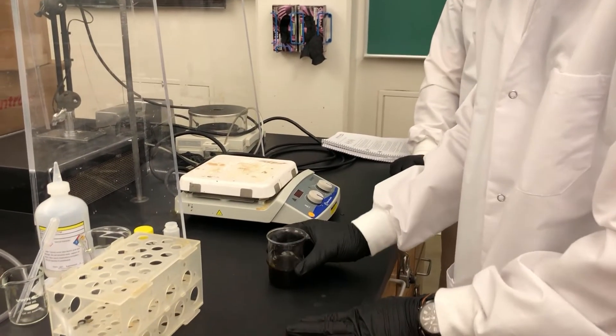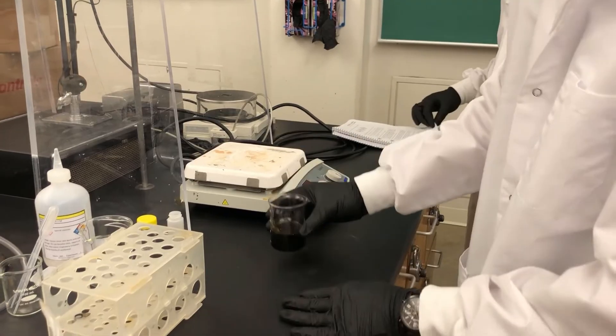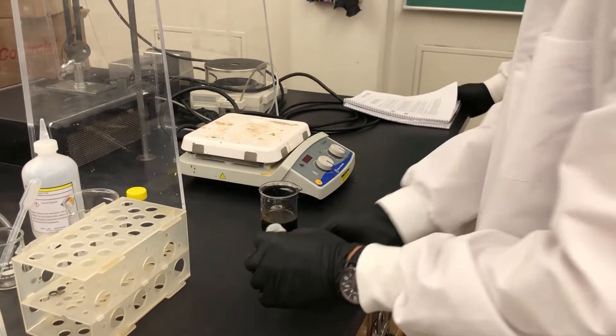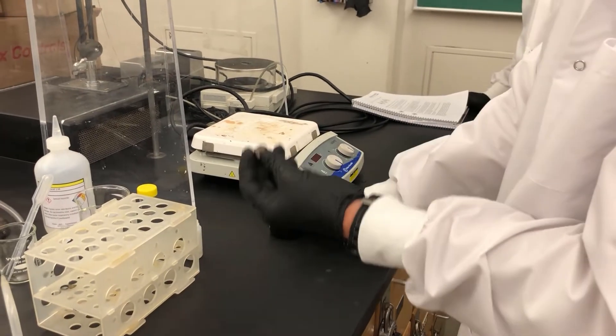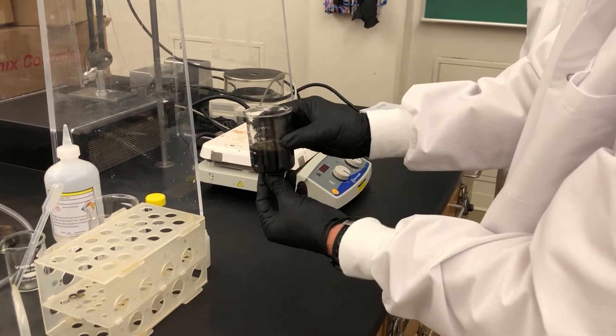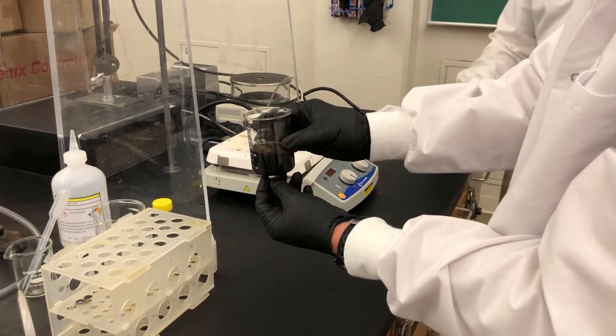Okay. The next step is to place a magnet underneath your prepared solution here. So I'm going to pull out this magnet.